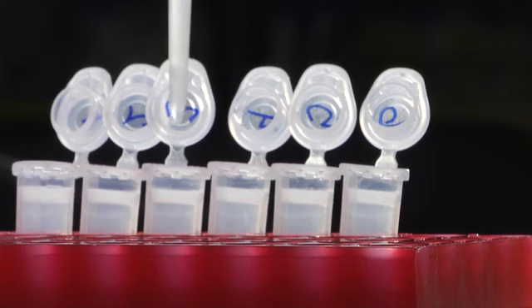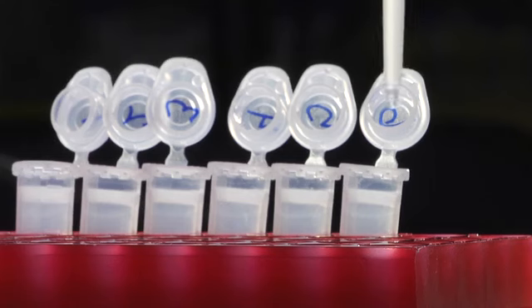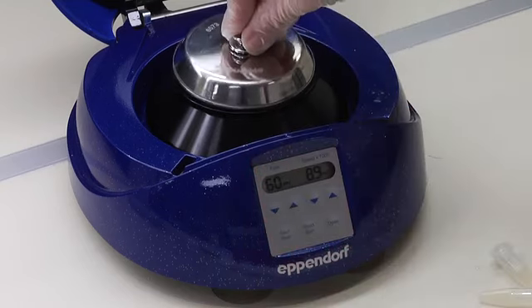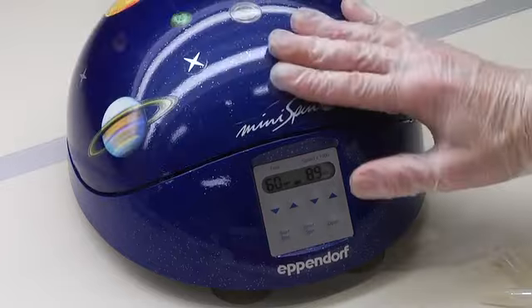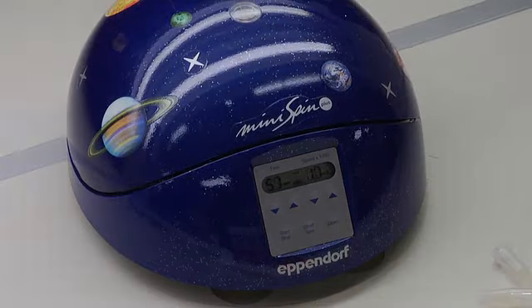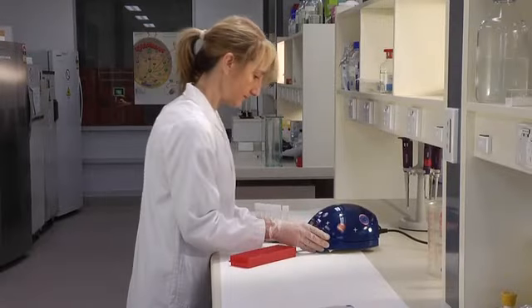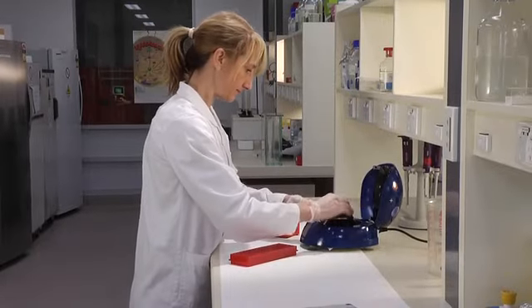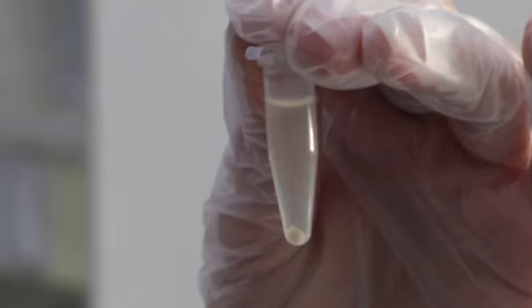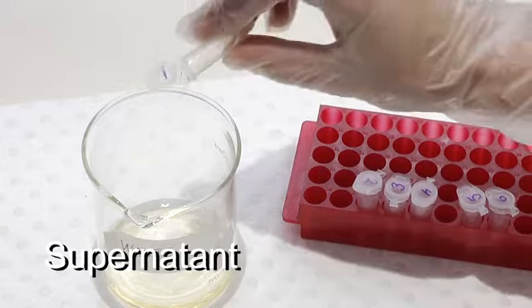Nucleic acids are insoluble in ethanol, so the plasmid will precipitate when we centrifuge it again. Once the plasmid's precipitated, we can throw away the supernatant.